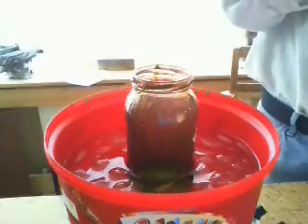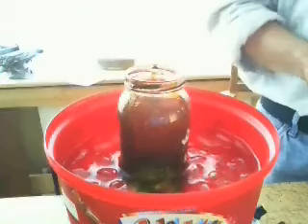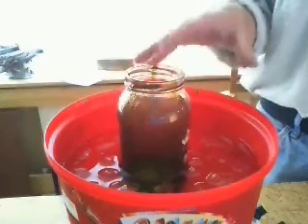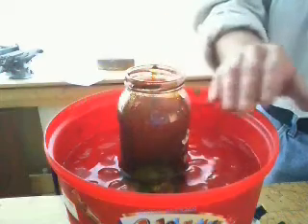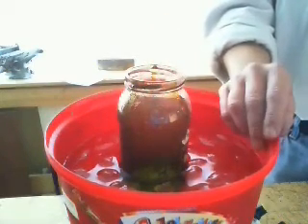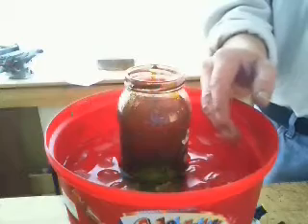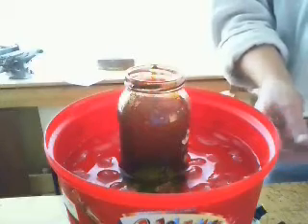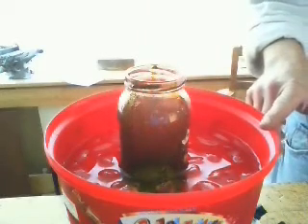This has been stirring for about two hours and it's gone from a purple colour to this purple-green colour. The next step is to raise the temperature of this water bath to 45 degrees and stir it for another hour at 45 degrees. It's been kept pretty cold so not a lot has actually happened yet, apart from mixing it — once it's at 45 degrees it's going to really react, so I'm going to take the whole thing outside. The way to raise this temperature without a water bath is to mix up some hot and cold water to 45 degrees, put it on the stirrer, and every few minutes test the temperature and keep adding a little bit of hot water to keep it at 45 degrees.